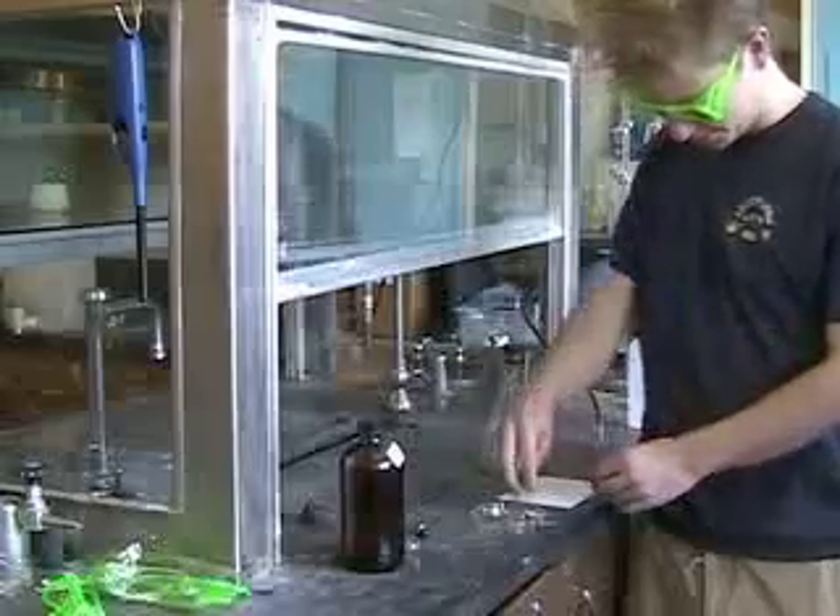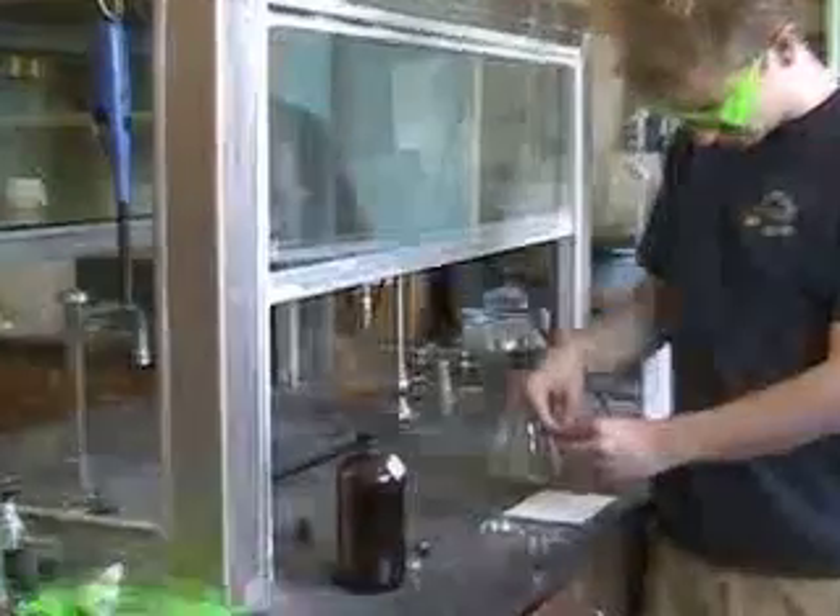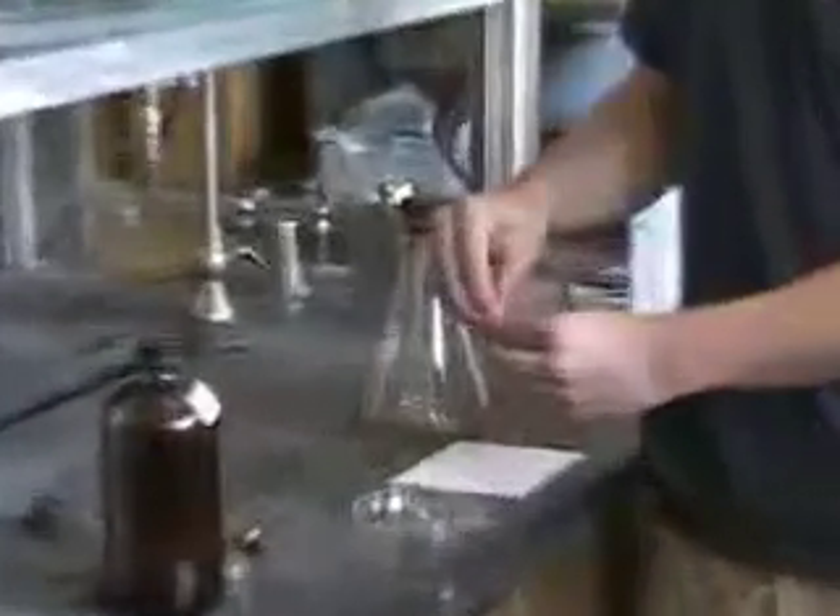The first thing we must do is put the alloy into a capsule. The capsule encapsulates it so that it doesn't begin reacting with the acid as soon as it comes in contact — the acid has to eat through the capsule first.